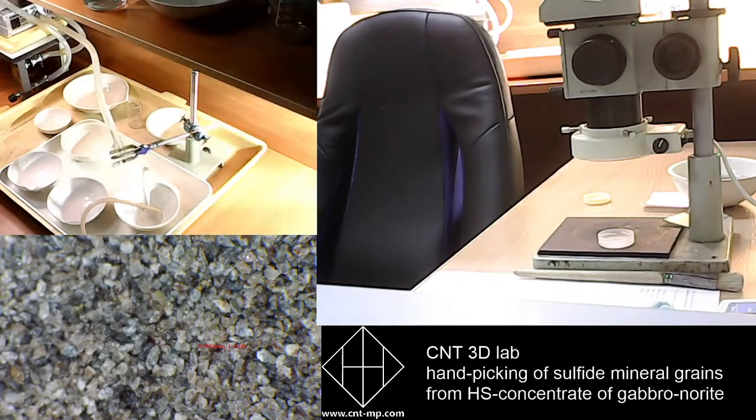And also we have to discuss how to make a final report on our studies, because it's no matter what kind of specimen we process, I mean ultramafic or felsic intrusion samples, or technogenic material, we always do the same operation.